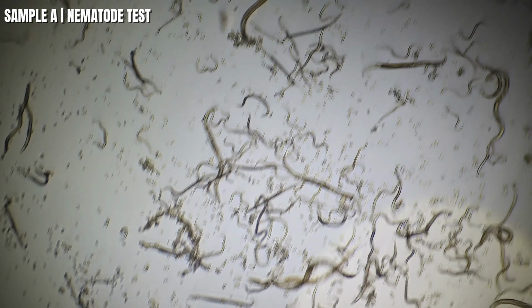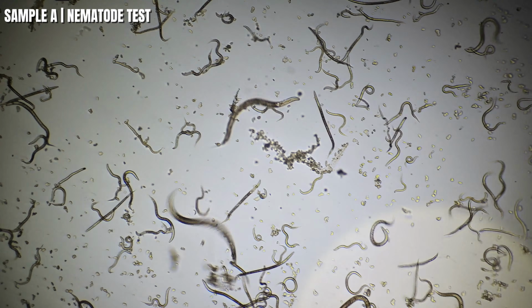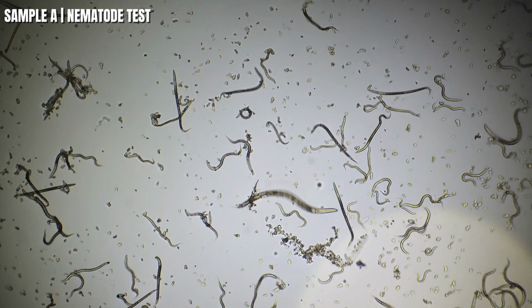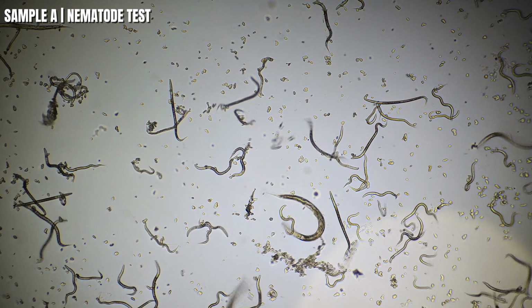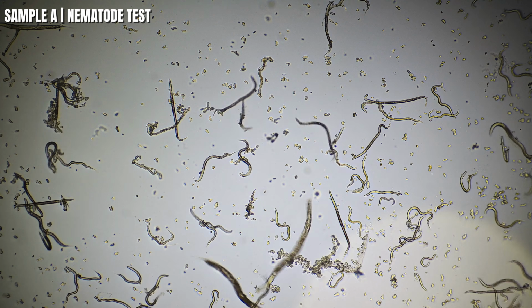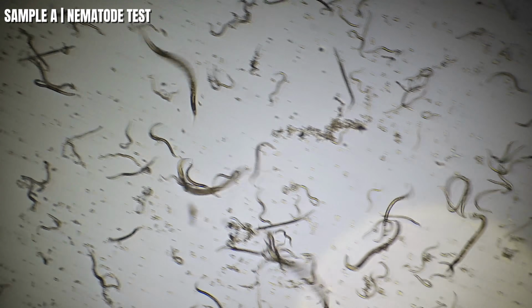So, okay, I zoomed back out and yeah, for sure, they're slowing down. There are many that are still active, as you can see. A lot of babies in there. Yeah, I feel kind of bad, but you have an adult right there still wiggling around. Must be Captain America. But anyways, yeah, significant drop in movement.